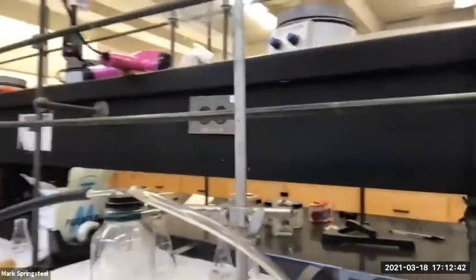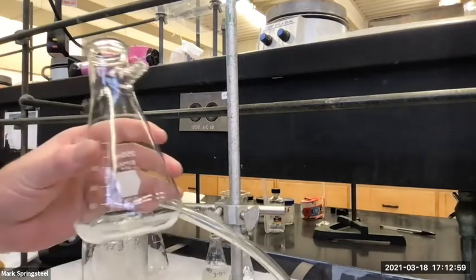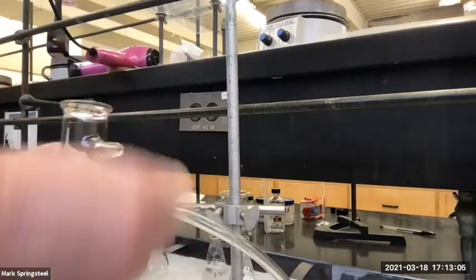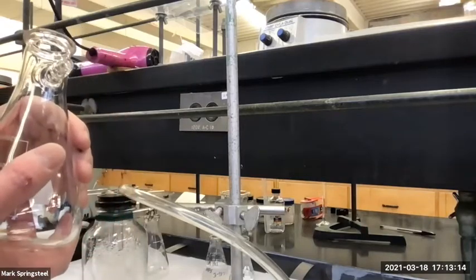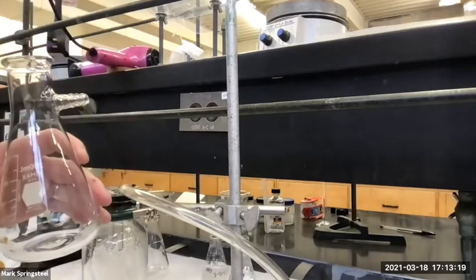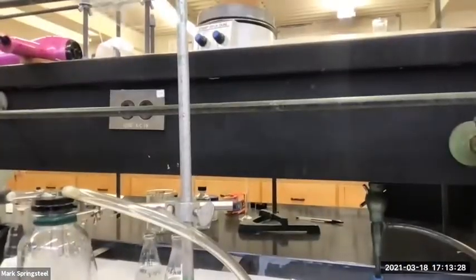Yep. Thanks. All right, and then now I will hook up my filter flask. It's very important to not get rushed at this point and use a filter flask that's dirty. I see this a lot. Students will have the last experiment's mother liquor, and they'll just hook up the new experiment. And then when they filter the new experiment, the filter paper doesn't work, and the sample gets by the filter paper, and now it's in a dirty flask with all kinds of impurities. So it's not really recoverable. But if you have a perfectly clean filter flask like I do here, if something gets by the filter paper, it's fine. It's in a clean flask. We can recover it.